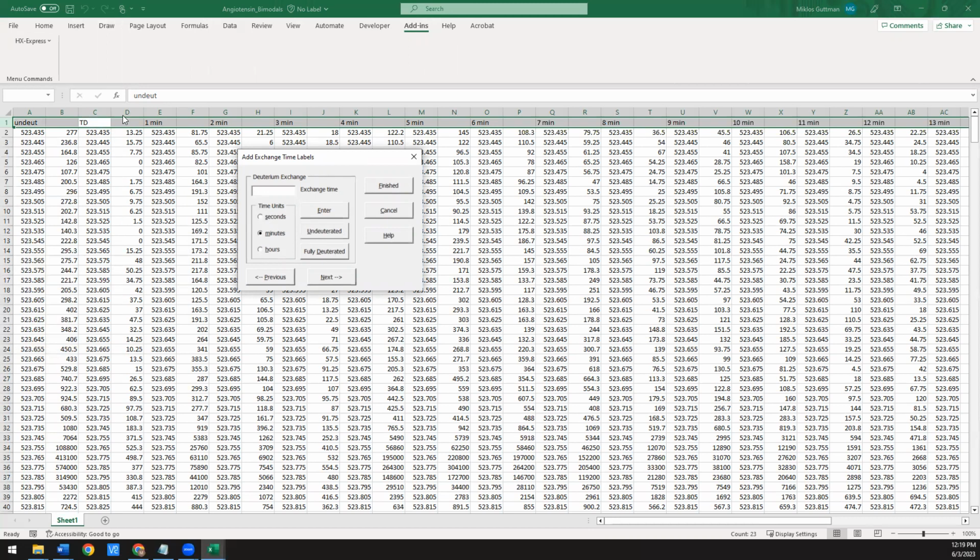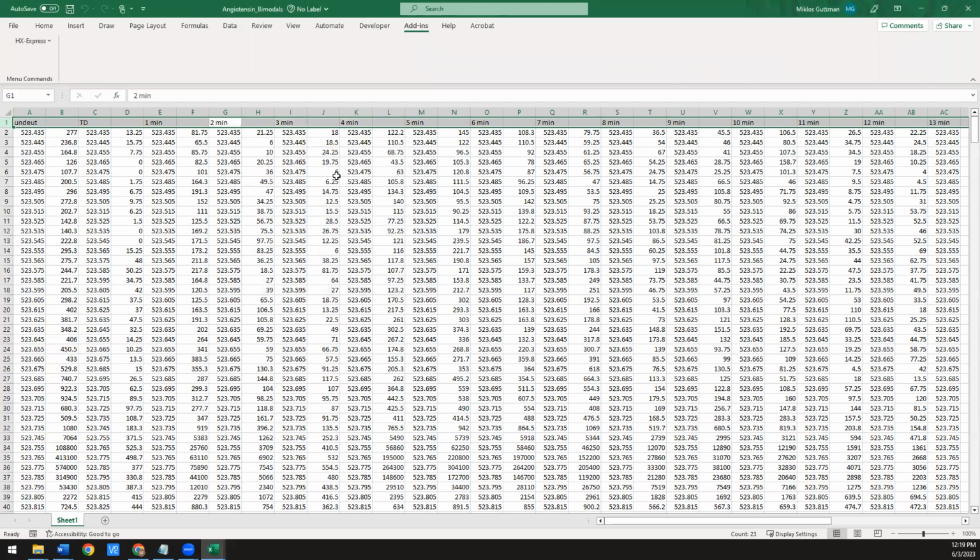This next one is a totally deuterated, or fully deuterated. And then here we had 1 minute. So if you hit enter, it'll update and keep moving on. You can always go back and forth. And then when you're done, you can say finished, and now you'll have everything labeled.